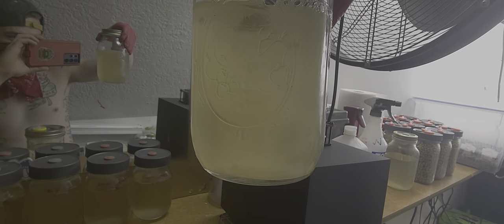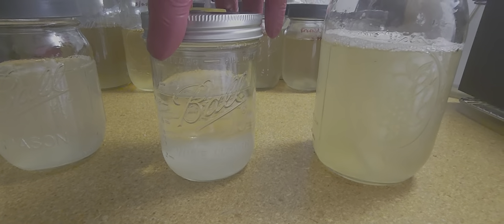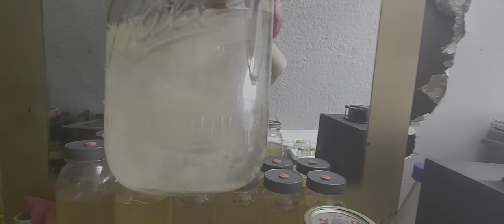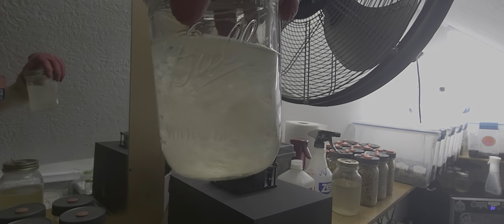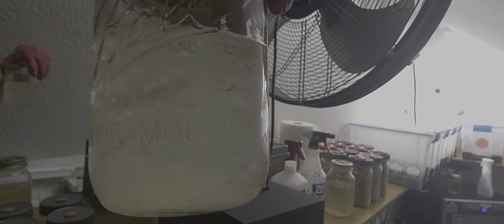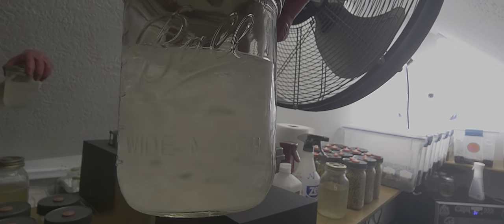So we're gonna go ahead — this is our good one. Now check this out, we're gonna go ahead and stir this up. Looky there — see how it is nice and clear, the water is still crystal clear. Doesn't look messy at all. That is a beautiful culture there, folks.